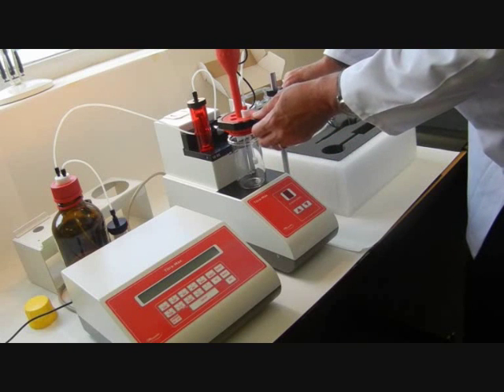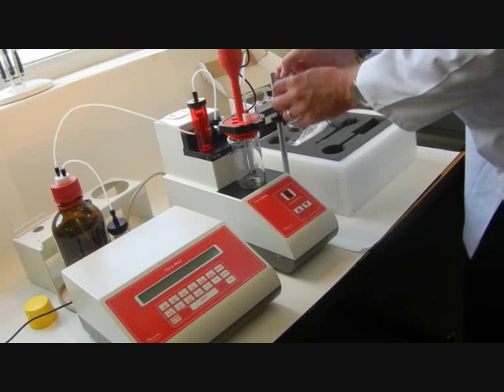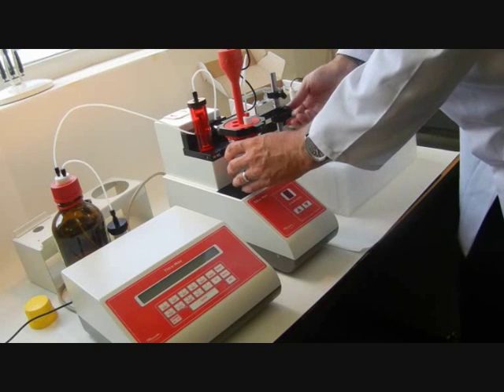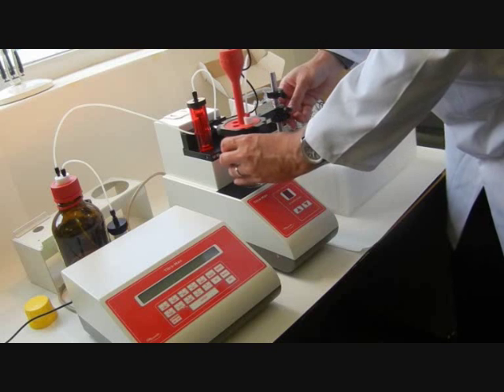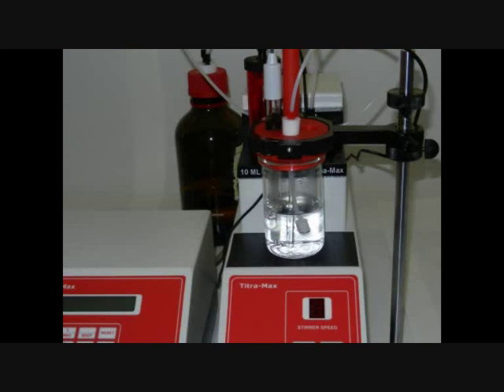We're just going to adjust the titration head there to rest on top of the titration vessel. It should fit quite snugly. It should be tightened so that you can just swing the titration vessel in and out without having to raise the connectors.